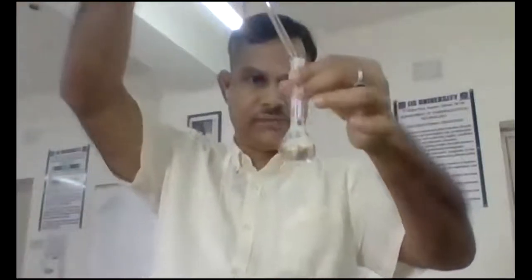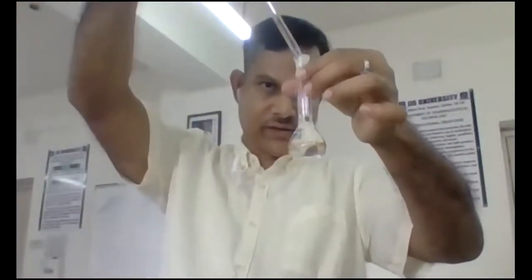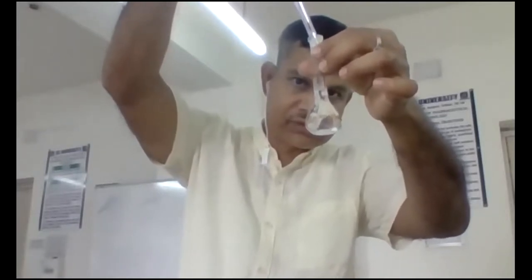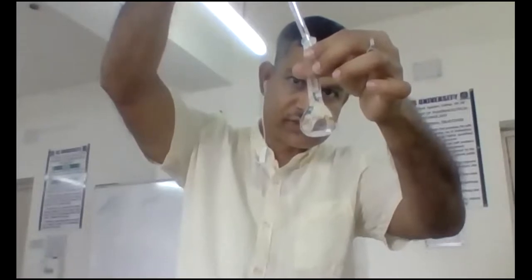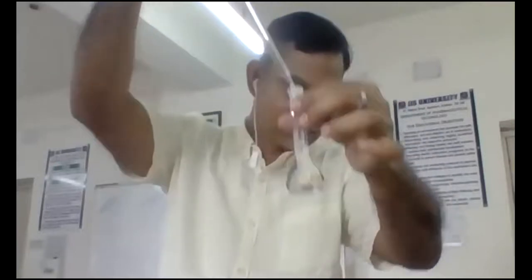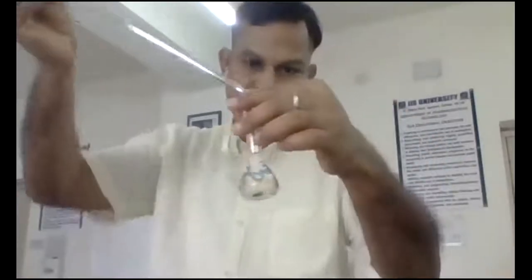The volume is being made up to the mark with more media. Very accurately, very carefully you have to do it, so that extra liquid does not come. In this way, for all the 6 volumetric flasks, I have to make up the final volume.